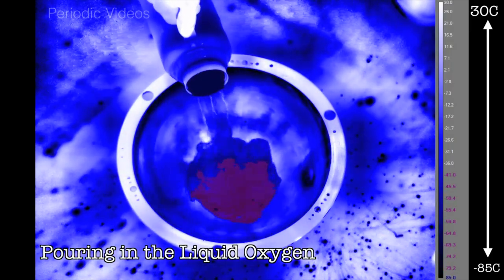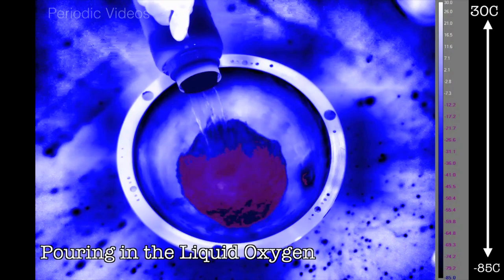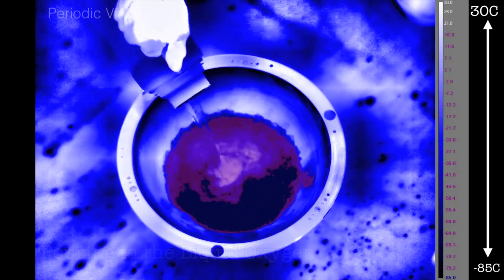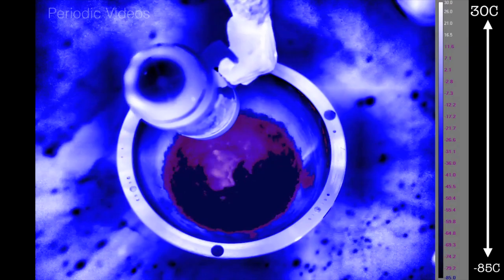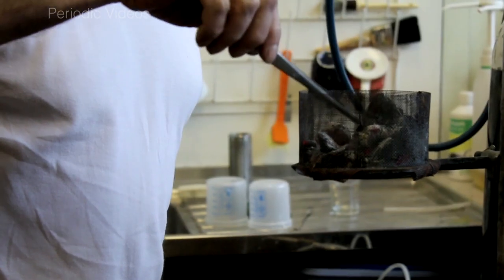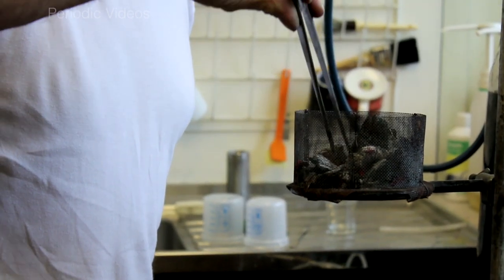So in goes the liquid oxygen into the pre-cooled metal bowl. Neil was ready. He had a container with several pieces of hot charcoal. Now obviously, when you drop them in, you have charcoal, which is carbon, which is going to burn really brightly in the presence of oxygen.